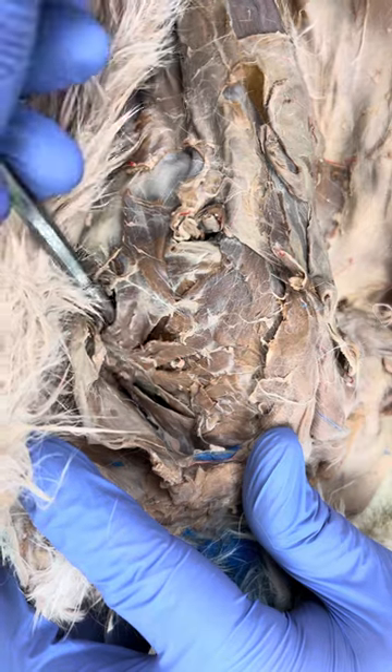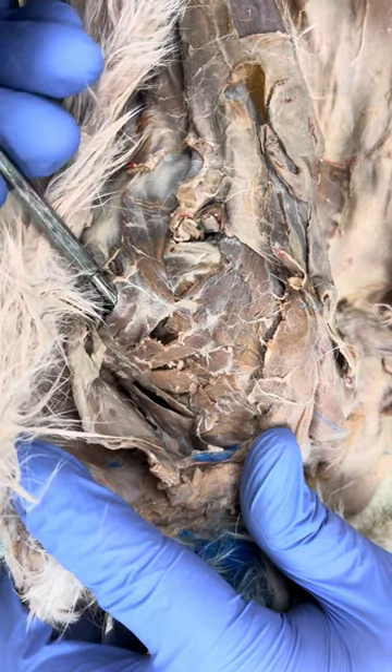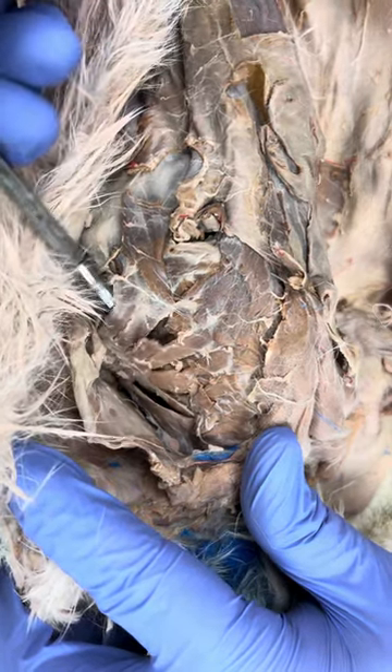You can see I accidentally broke one. But when we're done, it should look something like that — that's going to be my serratus ventralis muscles.